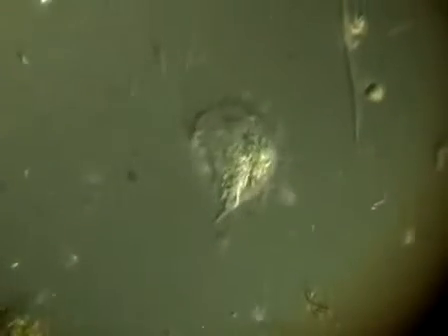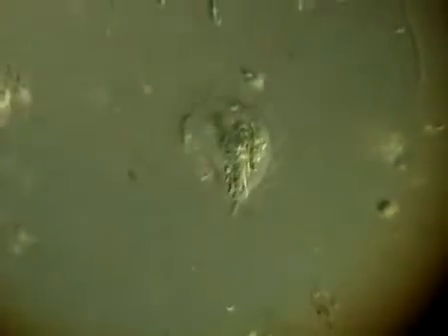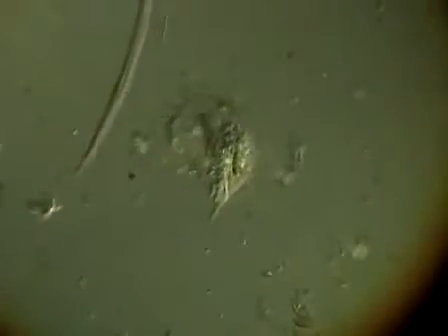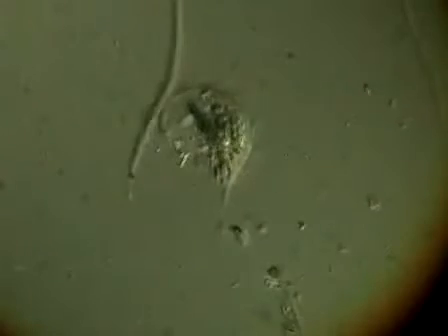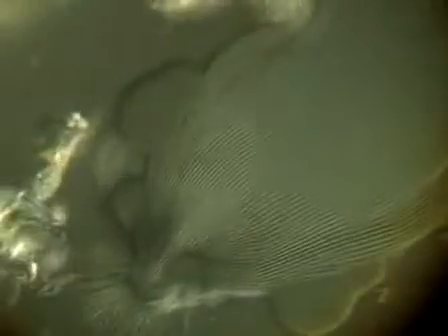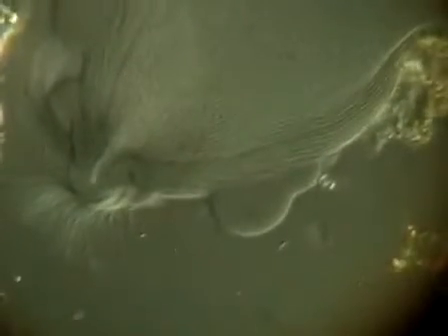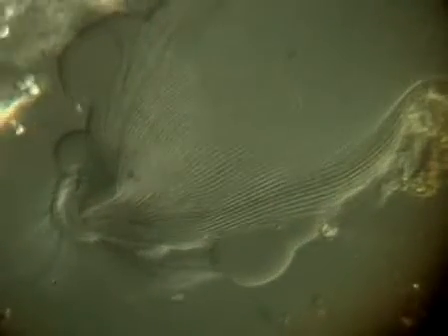And right now, with this one that's sitting right in the center here, I can adjust this a little bit to bring out some of this edge contrast. It's a little bit hit or miss. Okay. Oh, this is looking gorgeous. For instance, this is one of these very large Trichonympha-related protozoans, and it's starting to bleb out. It's starting to get ill. And that's what some of these little blebs out the side are.